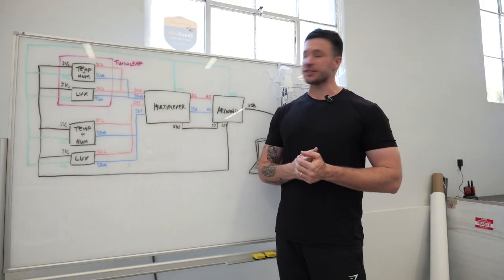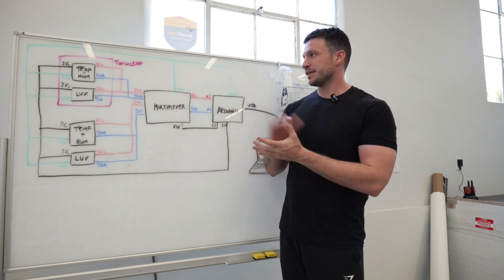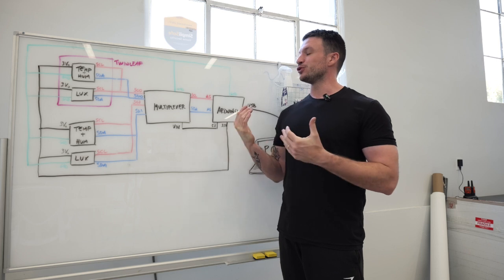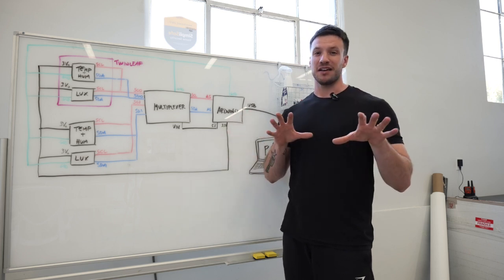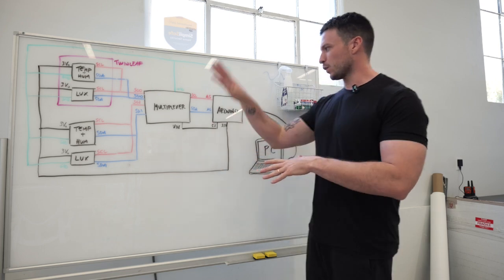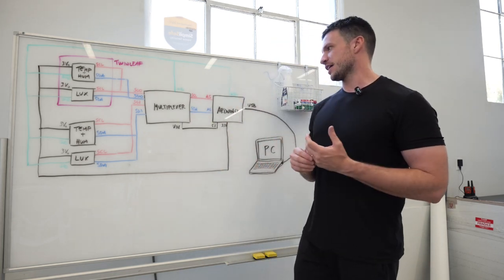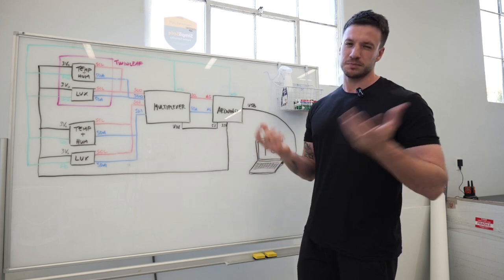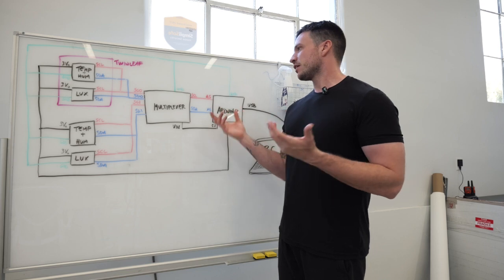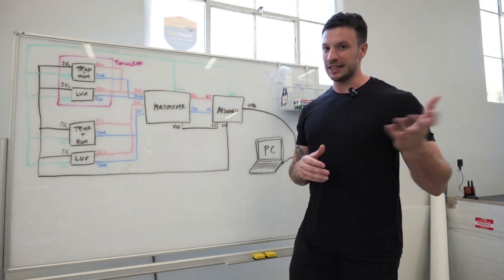So yeah, just a quick video here, but basically this is a pretty homemade DIY sort of solution for keeping track nicely of temperature, humidity, and light. And this whole setup is super cheap. The most expensive thing for sure is the Arduino, which is probably around $20 or so. And so this whole thing you can do for $50 or less.